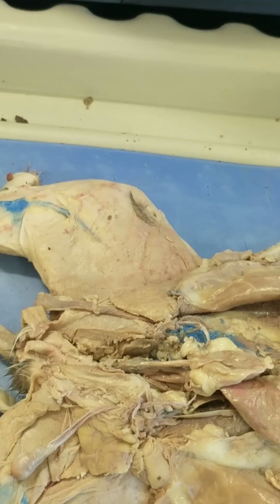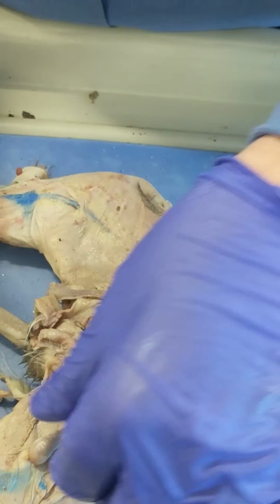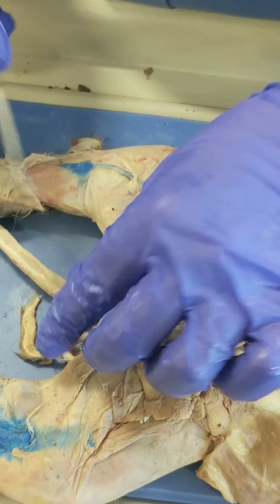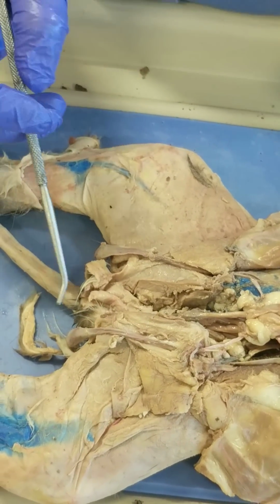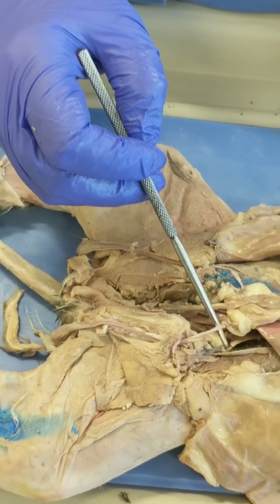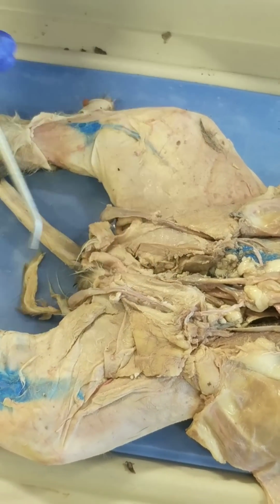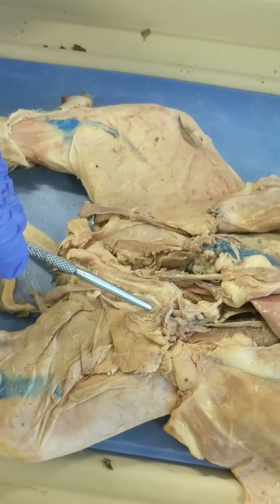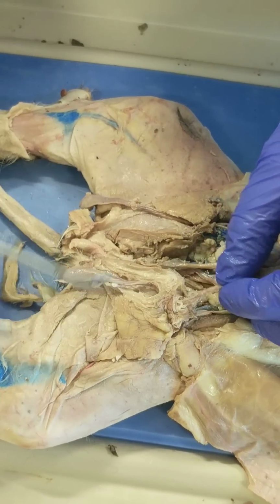So that leads us to the reproductive system in the male. And in this cat, we have both testicles exposed. Here's one, here's the other. That's where sperm is produced. And the spermatic cord contains the vas deferens, which we've identified in the body cavity, but the spermatic cord has the vas deferens as well as an artery and a vein. And the spermatic cord travels through the body wall in the inguinal canal.